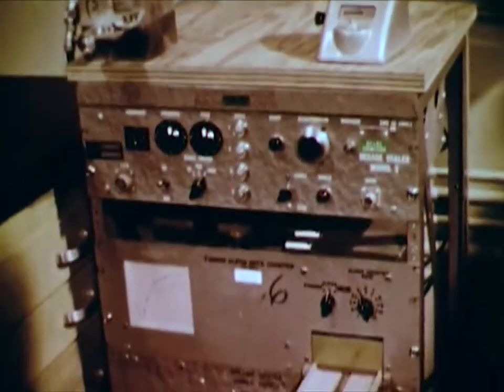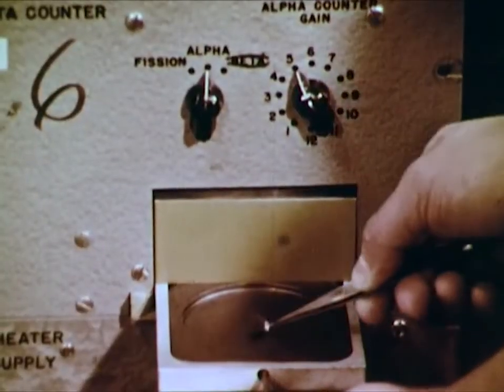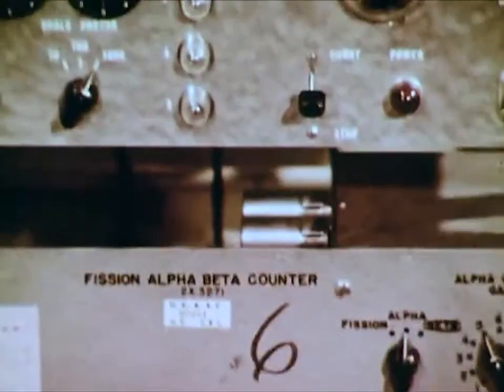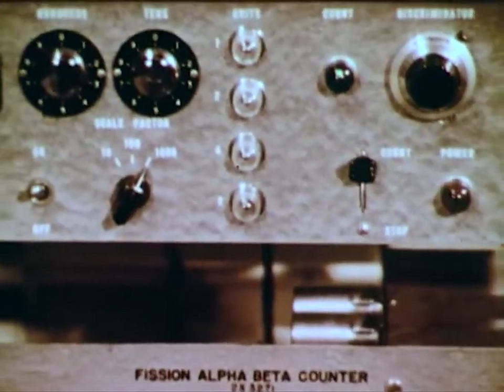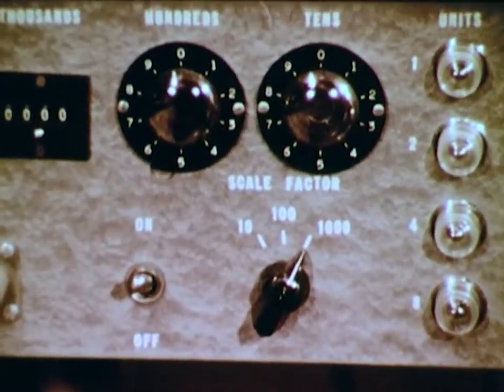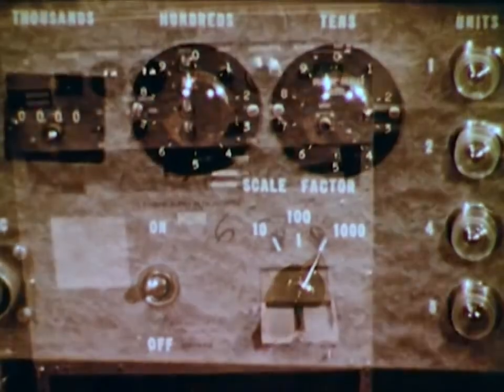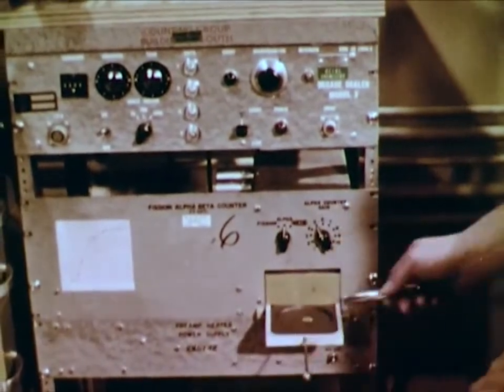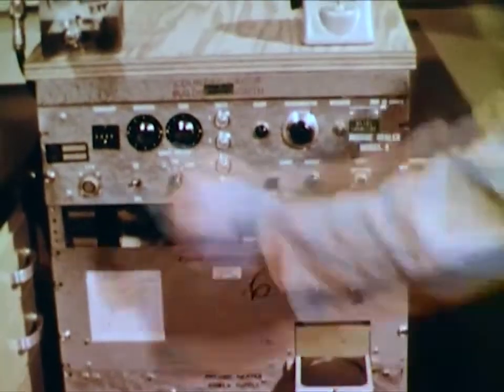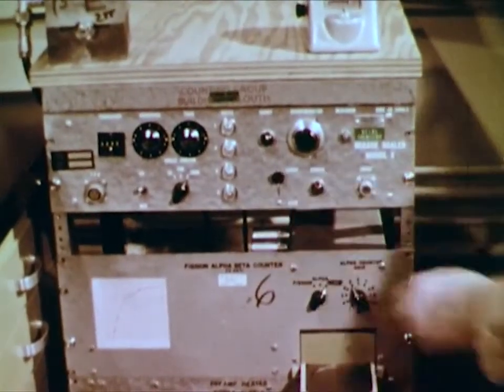Finally, we're about ready to test the disks for evidence of the four elements which we originally mixed and added to the column. This radioassay machine will detect both alpha and beta radiation. So even if only one radioactive atom on this disk decays, the energy release may be detected. We'll insert the disk that caught the first drop from the column. The elements that we're seeking have short half-lives, so one minute is sufficient to detect any decay activity.